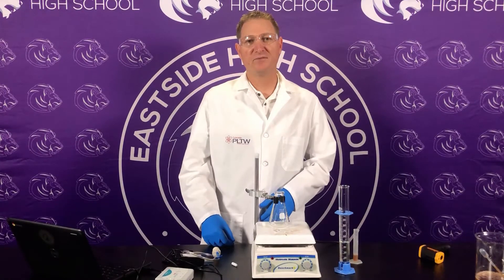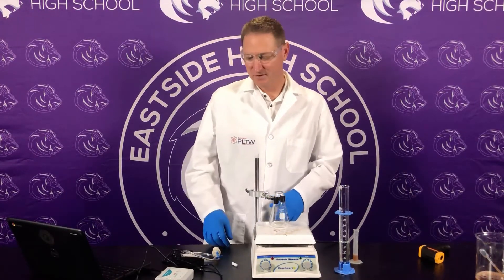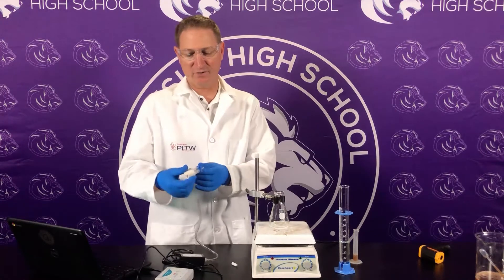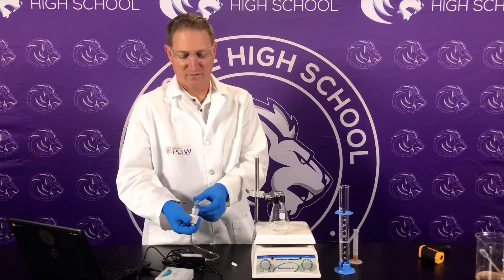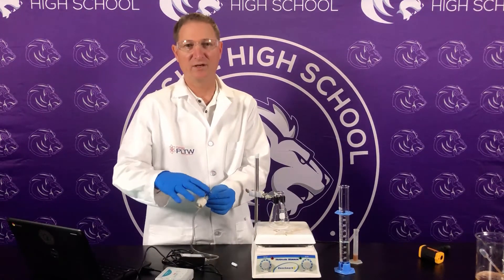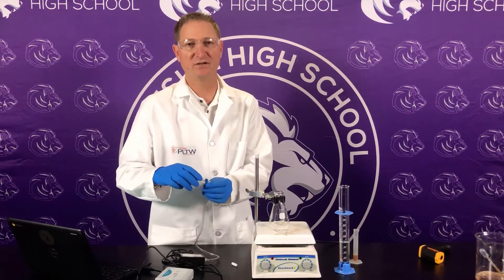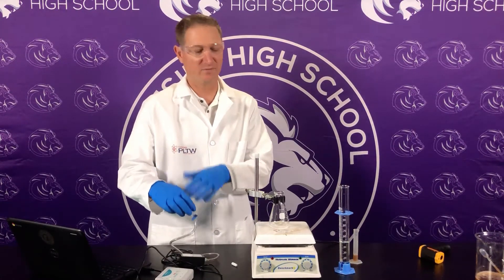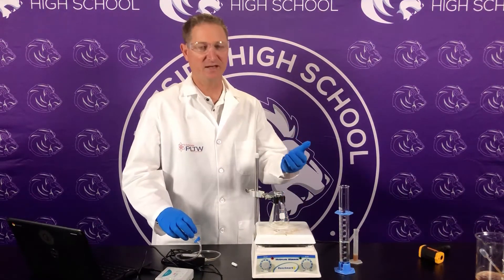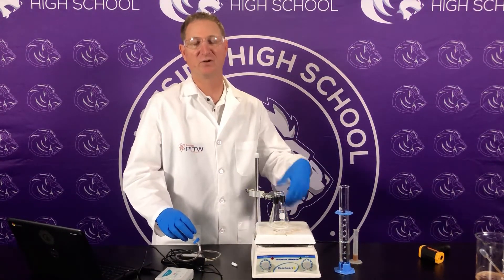In this portion of the lab we're going to use the variable of temperature. We have everything set up the same way. We're going to make sure our gas pressure sensor stopper is on so that we can collect all of the gas pressure inside, because that's what we're measuring — the pressure of the gas as oxygen gas is produced, the pressure should go up.